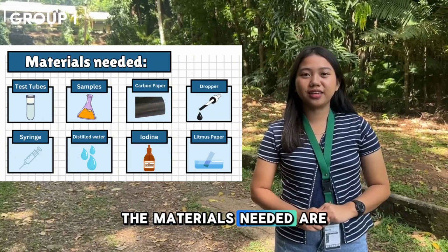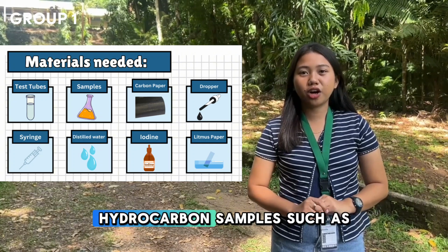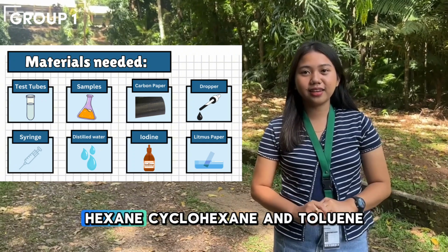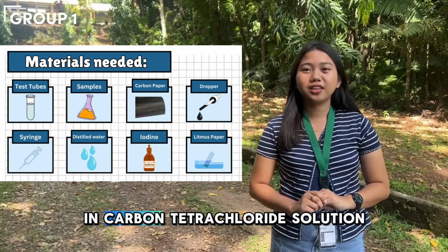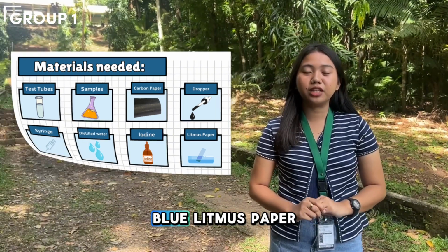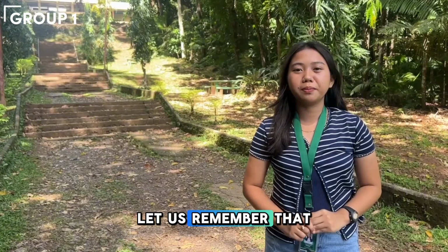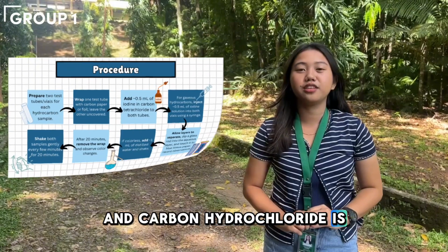The materials needed are test tubes or vials, two for each hydrocarbon; hydrocarbon samples such as LPG, ethylene, acetylene, hexane, cyclohexane, and toluene; iodine in carbon tetrachloride solution; carbon paper or aluminum foil, a syringe, distilled water, and blue litmus paper. Before we proceed to the procedure, let us remember that the color of the reagent, iodine in carbon tetrachloride, is purple.